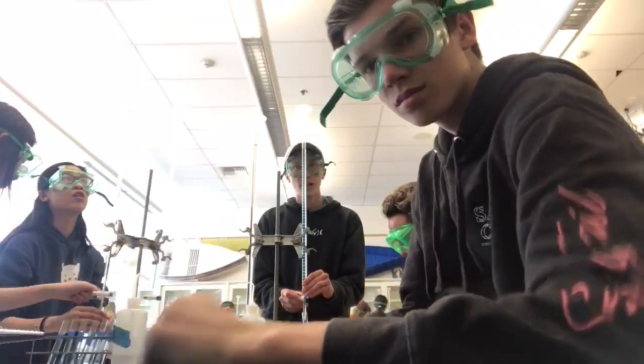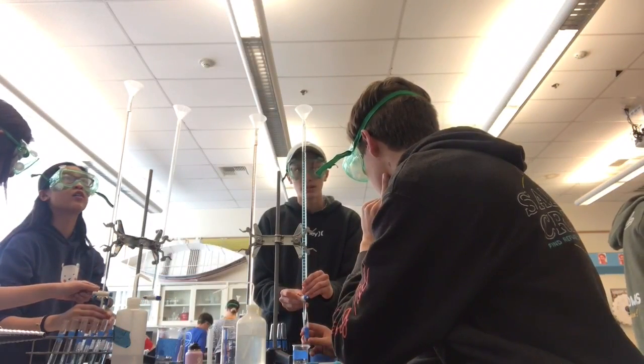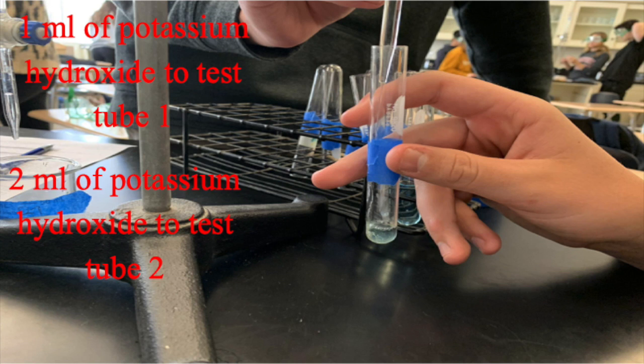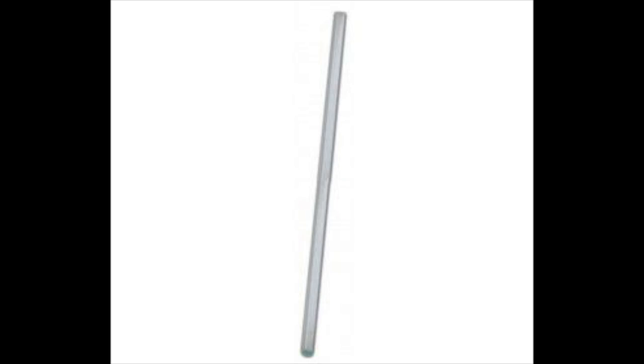Then once the burette was filled, we filled up 8 test tubes with 5 milliliters of copper 2 sulfate. After this, we added 1 milliliter of potassium hydroxide to test tube 1, 2 milliliters of potassium hydroxide to test tube 2, and so on and so forth. Then to finish off the setup of the lab, we added the desired amount of distilled water to each test tube for the test tube to equal 13 milliliters, and then stirred it with a clean mixing rod.